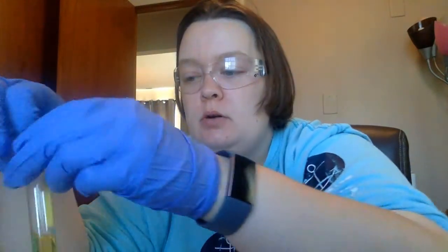So essentially, what we did in parts 1 and 2, we had an unknown substance leaking from the Acme Widget Company. They said this did not contain ruffinotoxin to kill our fish. But what we did in lab 1, we used gel filtration chromatography to separate the mixture into 3 components.